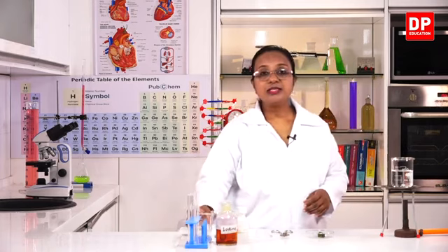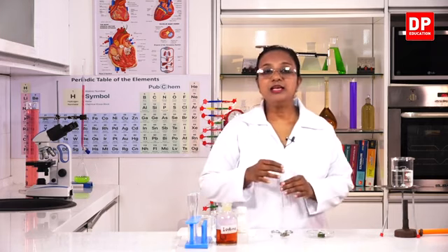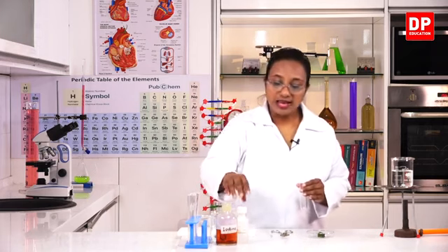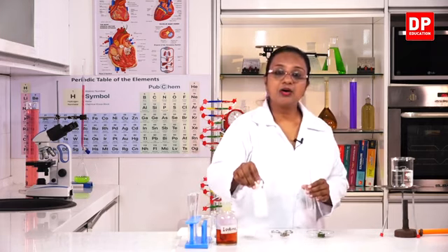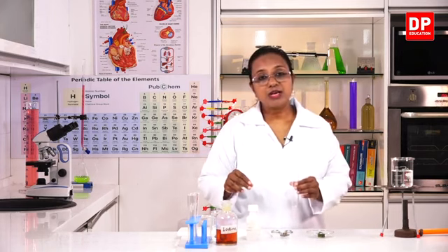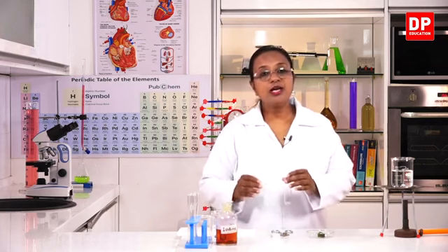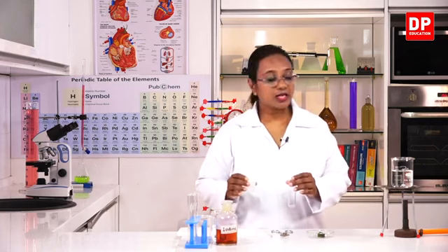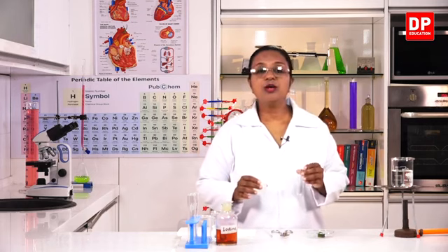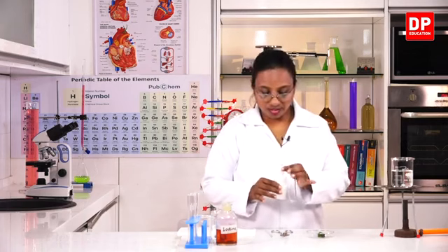You all know, students, the next step is we have to boil this leaf in alcohol, and this is ethyl alcohol, which is highly flammable. It can vaporize quickly and catch fire quickly. Therefore, it is not correct to hold this tube to the direct flame. Therefore, I have to use this water bath.